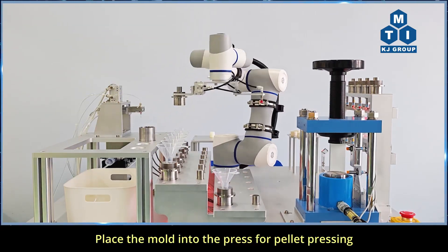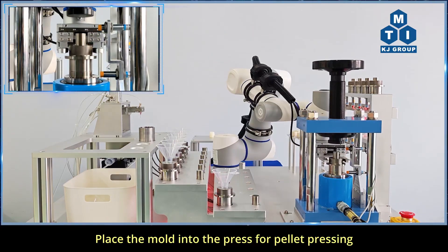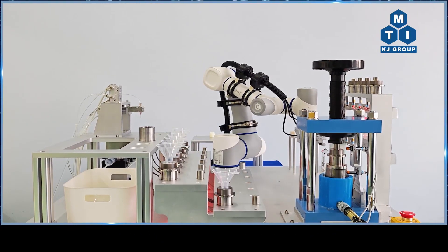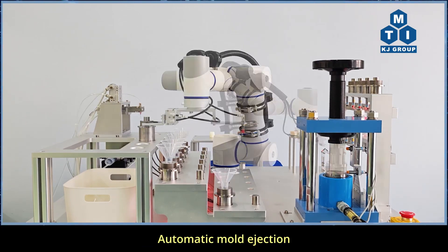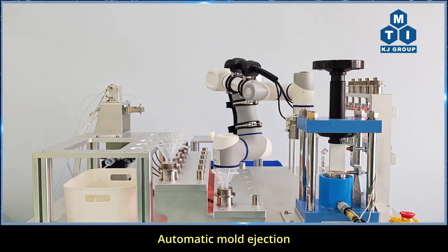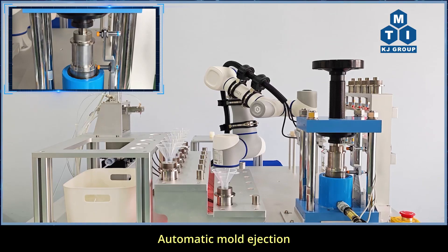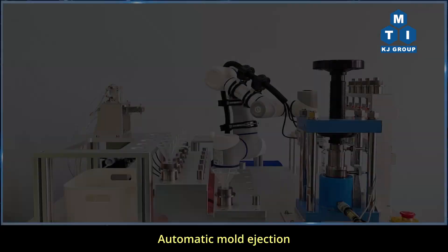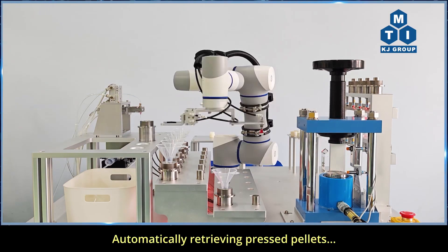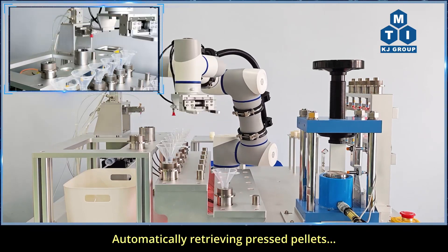Place the mold into the press for pellet pressing. Automatic mold ejection. Automatically retrieving pressed pellets.